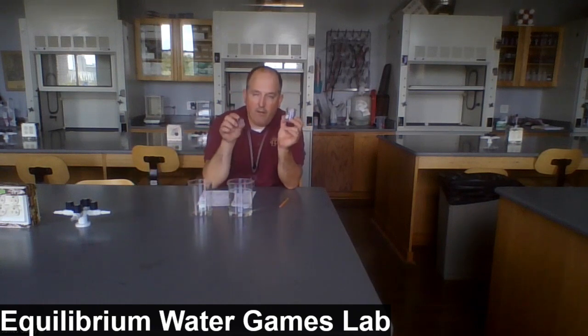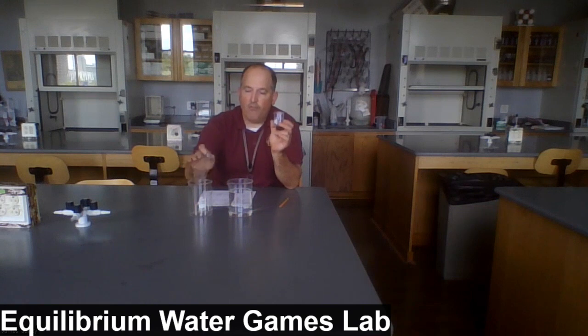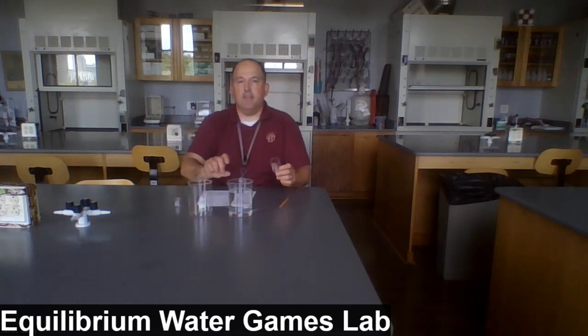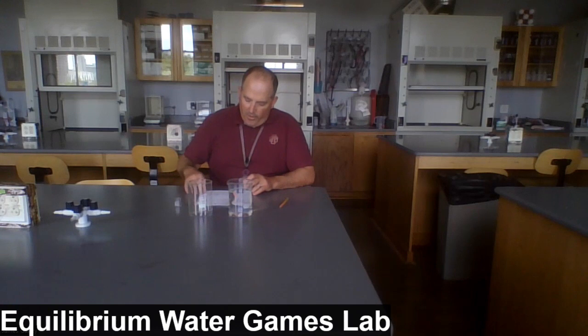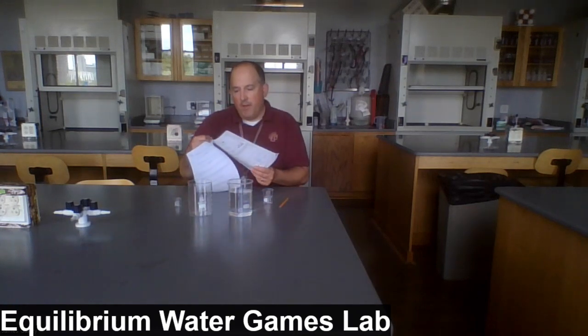The other beaker is a really tiny 10 milliliter beaker that will be used to transfer water from the large beaker B to beaker A. Now, the rule is you can't tip the large beakers. You've got to let them be exactly as they are. And we're going to record a lot of volumes. So if you look at the data table, there's quite a bit here.